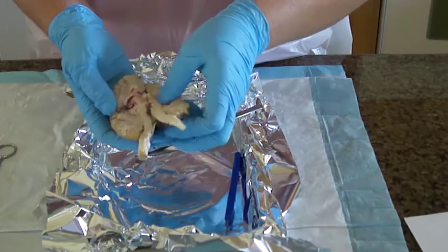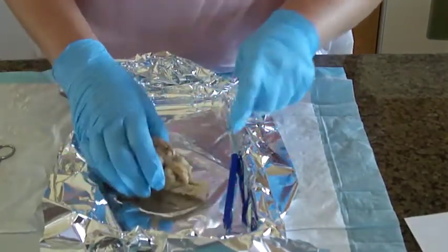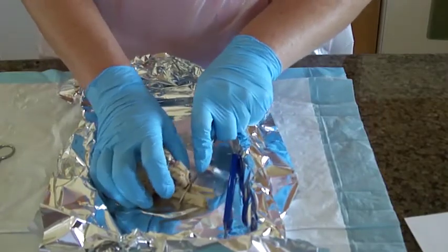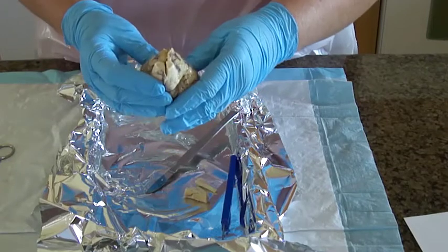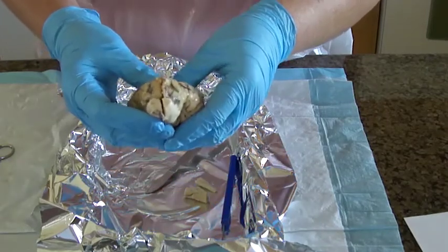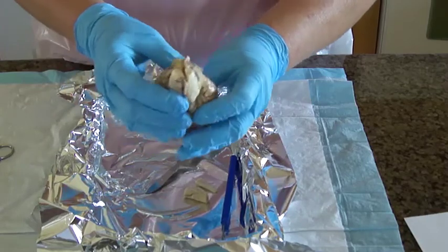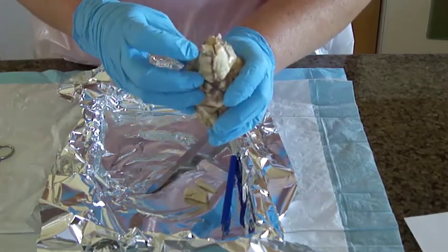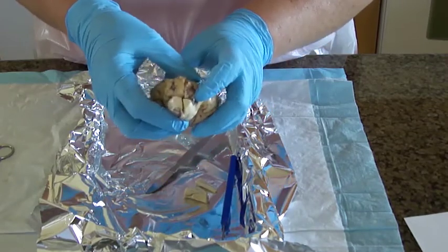Okay, slice a cross section of the spinal cord. So we will do a cross section. Oh my god, this is so gross. And we note the butterfly shape of the gray matter and the dorsal and ventral roots on the outside of the spinal cord. And I think that is it.